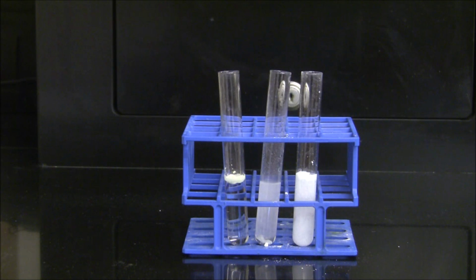When the product hits the test tube, it immediately begins to bubble. We would say that this particular substance is active with hydrochloric acid. If we want to test what that gas is, the test we're going to use is a wafting test. And this is where it would have really been helpful if you were here today.